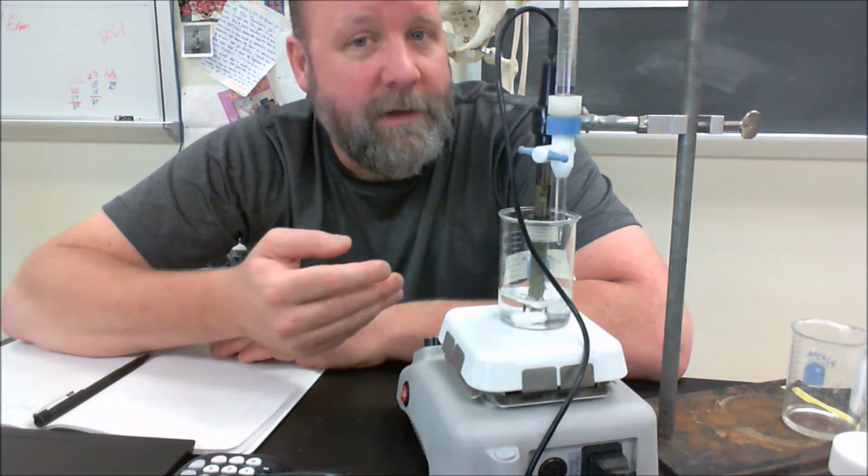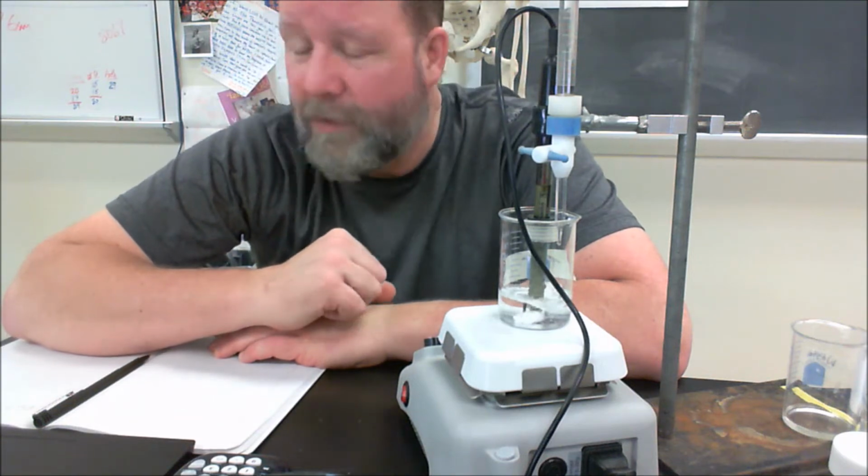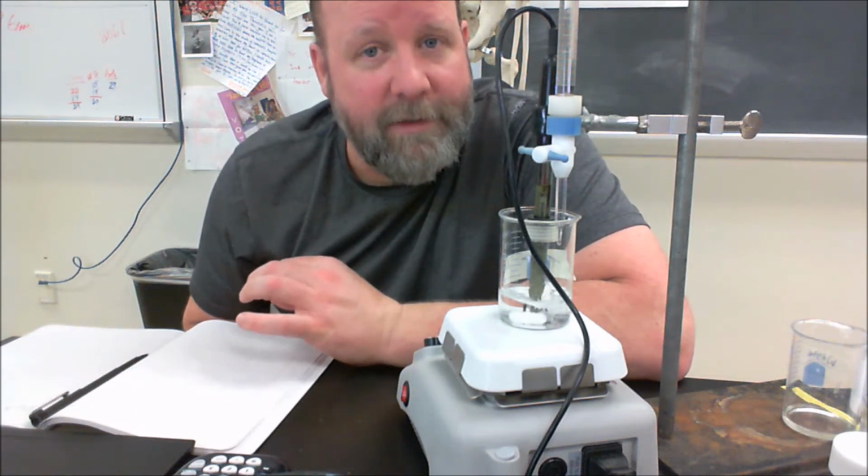I'm going to go past that to find the equivalence point, and then half of the volume that I've added, at that point, that's the place where my pKa is equal to the pH. So I'll just see what the pH was there. So I'm going to start by taking some readings. When I go to collect the data, I have to type in the volume that I've added and then make a reading, and it's going to tell me the pH.